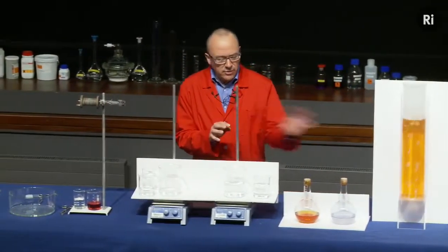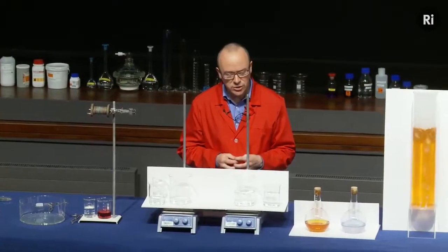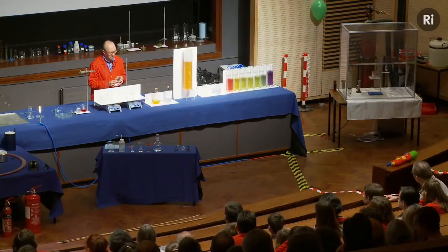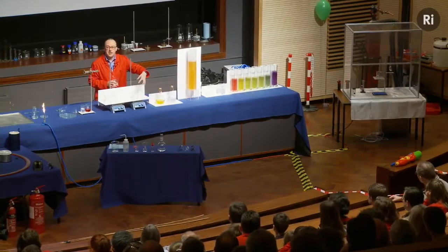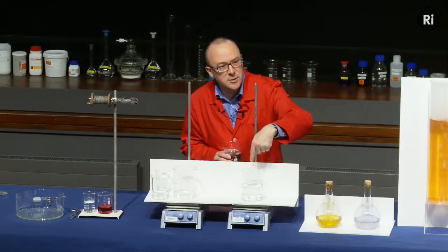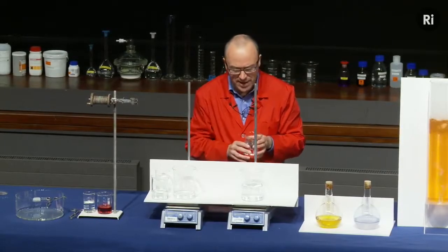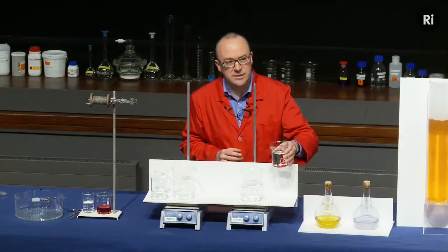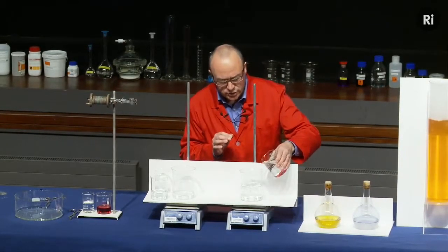So in the reactions we've seen so far then, we mix two things together and we got a colour change. So let's have a look at what happens when I mix these two colourless liquids together. So first of all, this machine is just called a magnetic stirrer. It just spins this little magnet and keeps the liquid stirring. It's just because I'm too lazy to stand here and stir them by hand. So we have a colourless liquid being stirred, and we add a second colourless liquid, and watch closely and see if you can detect a colour change.